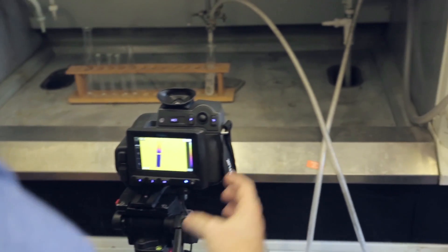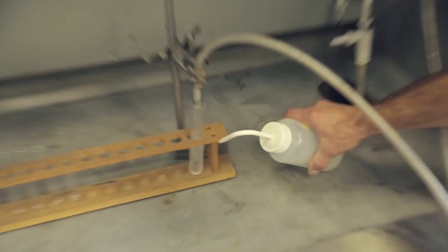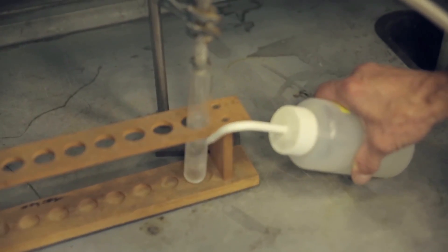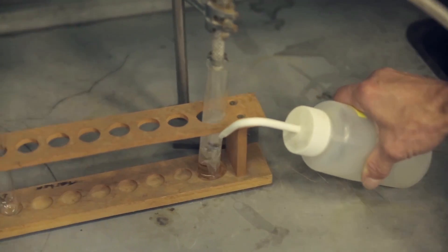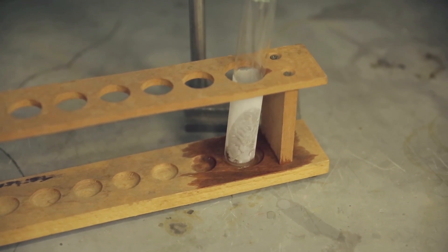Now, the part that Neil really remembers is that after the teacher had done this experiment for a bit, he squirted some water onto the outside of the test tube. Now, remember the test tube is pretty cold, so the water cooled down and actually froze. So ice was formed in a pool at the bottom of the outside of the test tube. And not only was it formed, but effectively sealed or glued the test tube to the test tube rack.